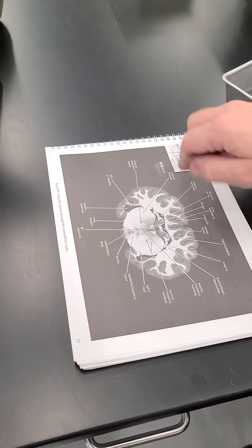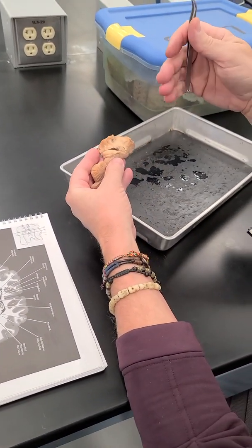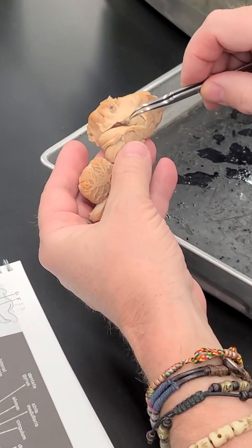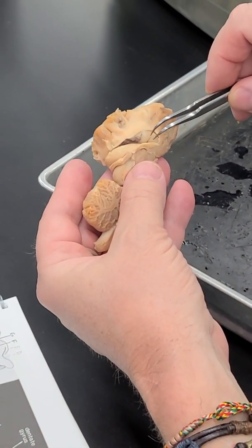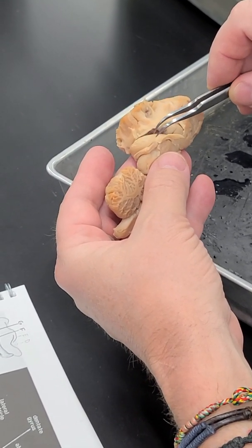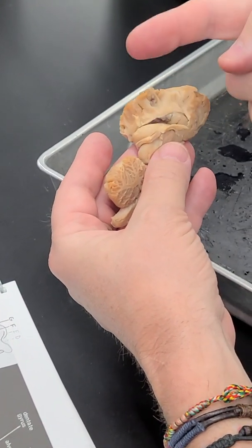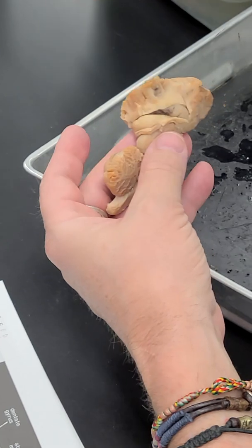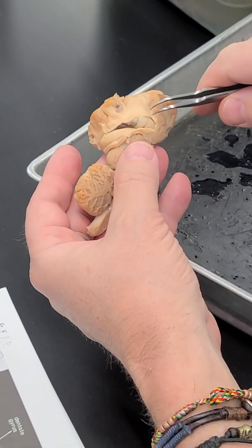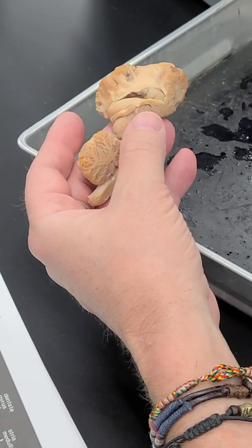And this is about the same place that the hippocampus is becoming visible. And so if you think about this view, the caudate narrows down out here lateral to the ventricle, and the fornix is coming up and enlarging as the hippocampus as you continue to move caudally, and then the hippocampus wraps around. So underneath the caudate nucleus are the globus pallidus and the putamen, the rest of the corpus striatum.